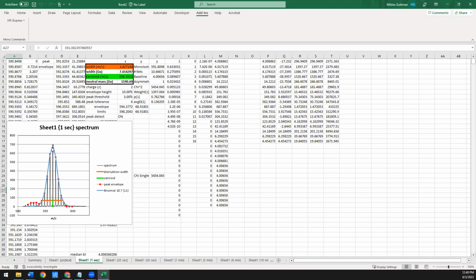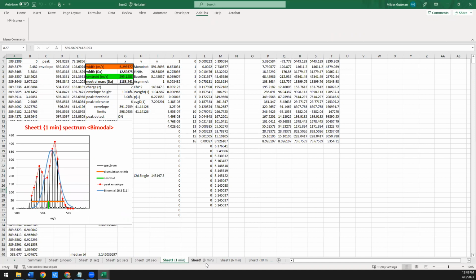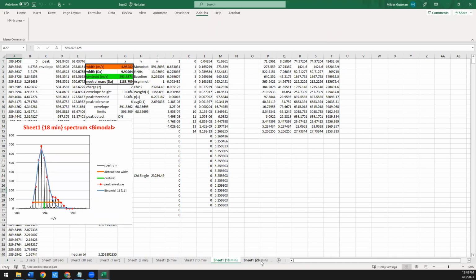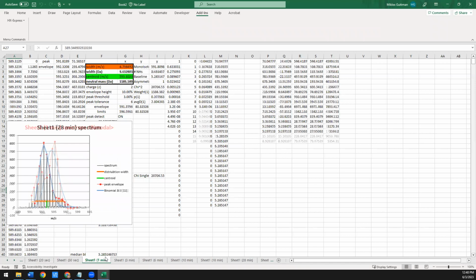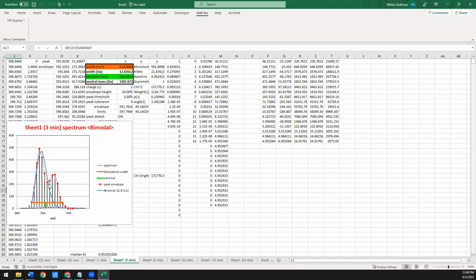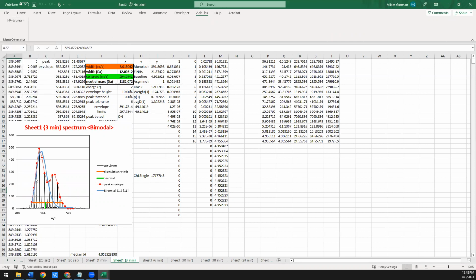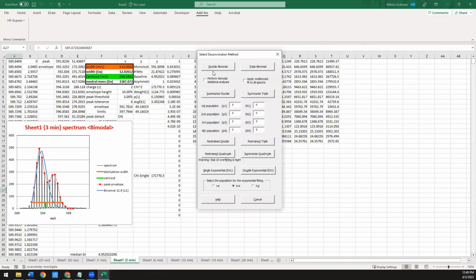As we look through the time points, we see that, okay, fit well to the unfolded state here. And then as you go later in time, of course, that single binomial is not gonna fit well once you have more than one thing in there. So now what we wanna do is we actually wanna fit the double binomial to both of these. So first thing I'm gonna do is just select one where I see both populations pretty well resolved. Let's go with this one. And I'm going to use the bimodal deconvolution to do just a standard double up here.